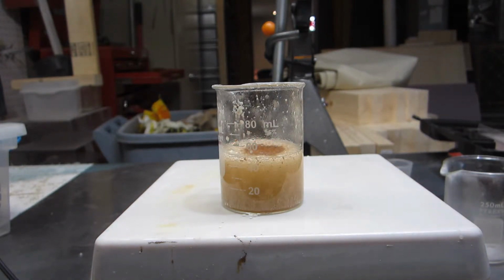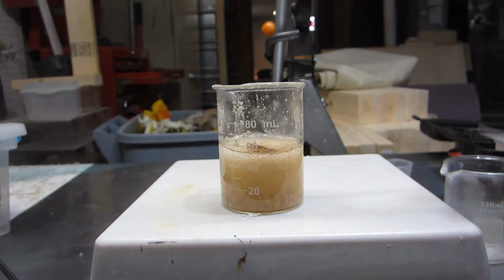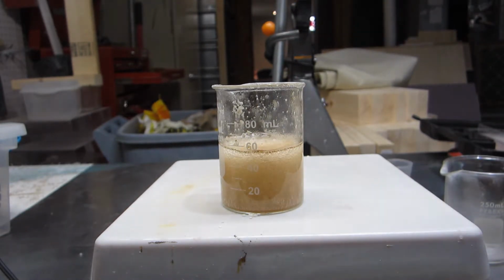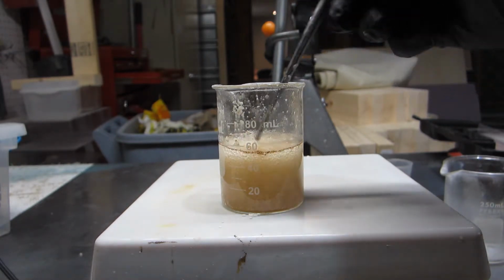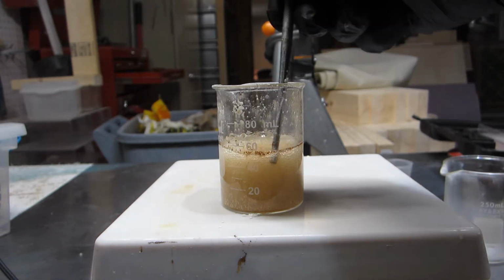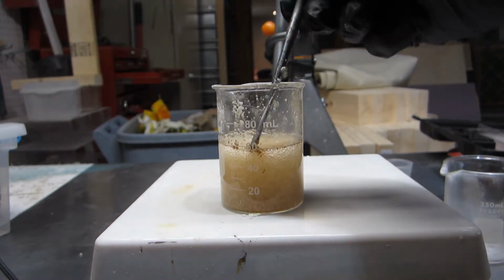Alright, so we'll use the old newbie here. Have a little peek at what the temperature of this stuff is. So it's about 115 C right now. I wonder if I can take some of this crud off. I'm going to do that. Just skim some of this garbage off. So something has changed, those little particles are just now coming out of the solution. Whatever that is being ejected from the solution, maybe this will actually clear up.